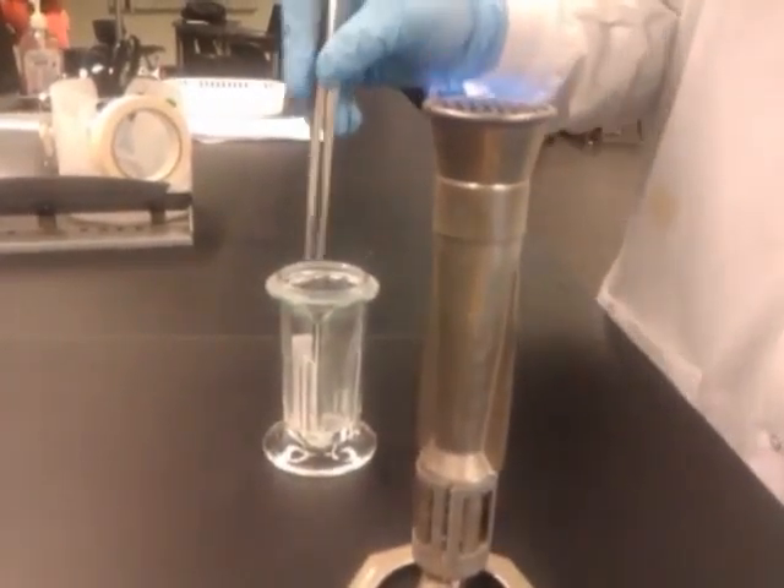Alright, you can see how it's run up. So here's your plate. See that it's colorless, so now you can't see any of your spotting. So we'll burn it on a Bunsen burner right here.